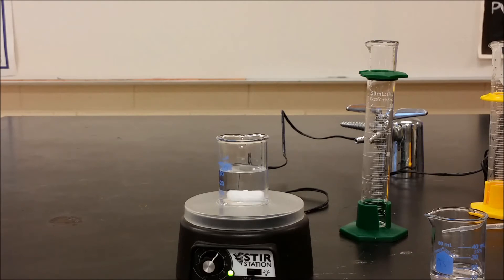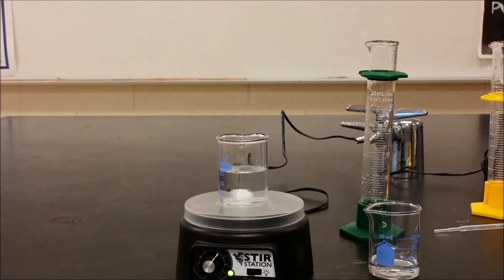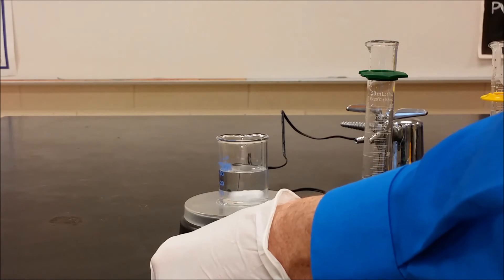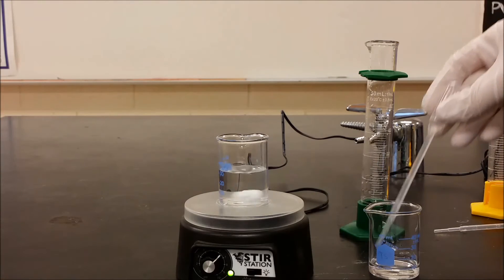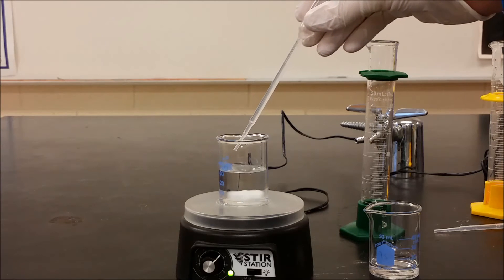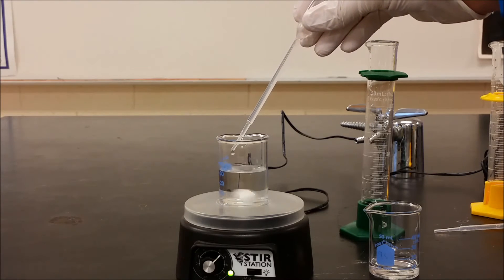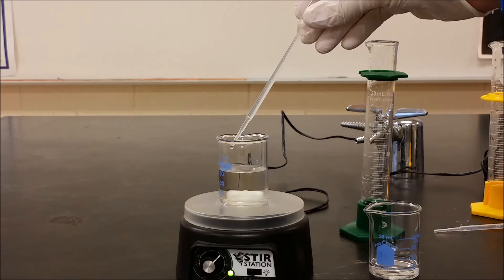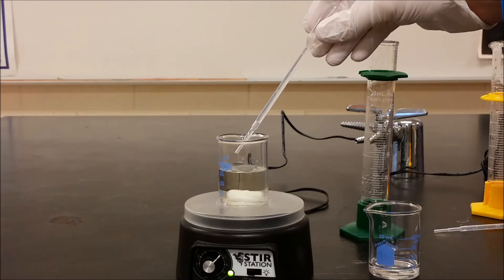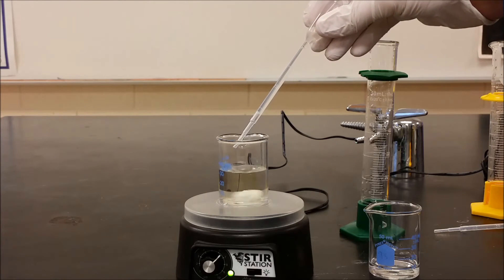This is a 6 to 1 ratio if we were to add all of it. Once you set up a stir bar in there, you just want to add the silver nitrate really slowly, drop by drop. As you do, you should see a yellowish color develop, and those are the silver nanoparticles forming. You want to be slow because you don't want them to clump too much — they'll last a little longer.